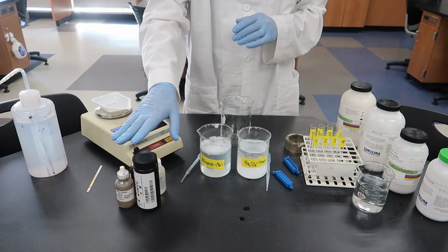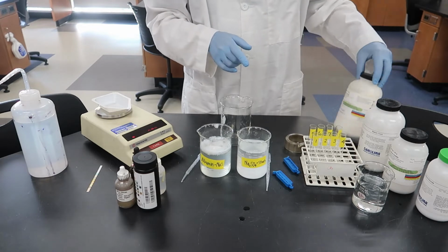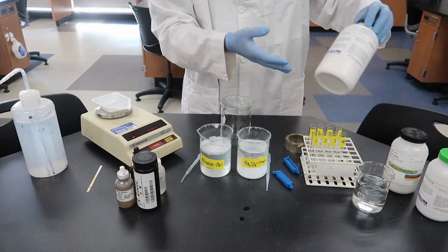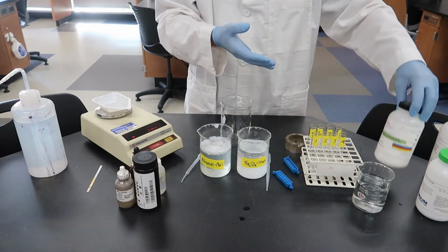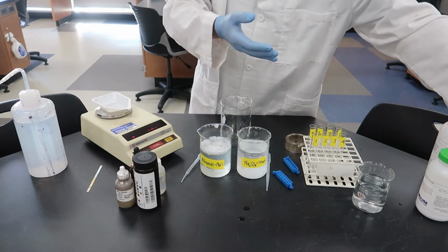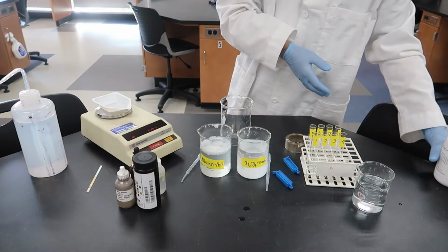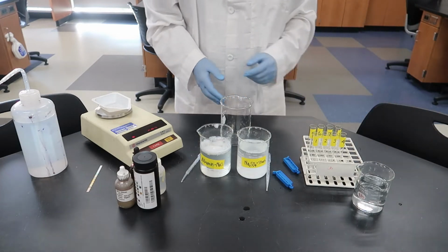Okay, I've got my solutions, I've got my test tubes, I have my scale, we'll talk about that in a minute, I have my indicators here, and let's run through some of these real quick. My solutions came from powder, so here's my albumin, which came from egg white. Albumin is a protein. My cornstarch, we've used starch before. That's a complex carbohydrate. There's the sodium sulfate, a salt, and sodium chloride, another salt. And again, those were mixed ahead of time and are already in the labeled beakers.